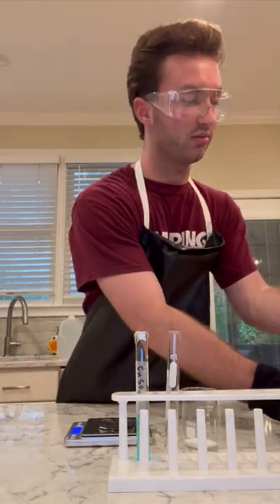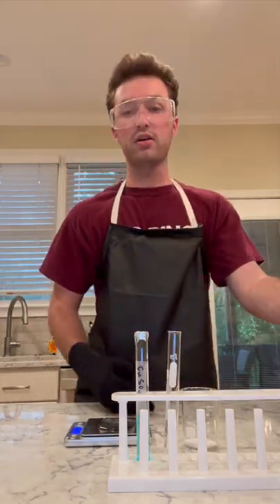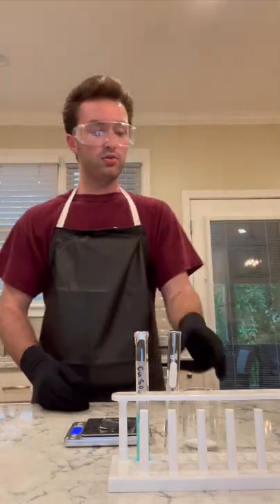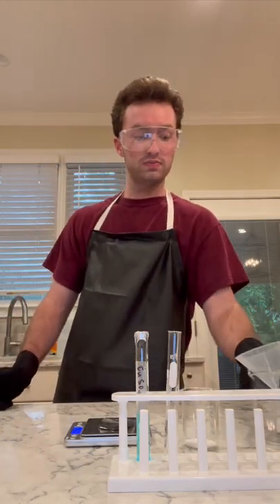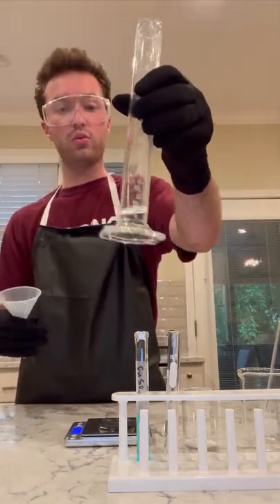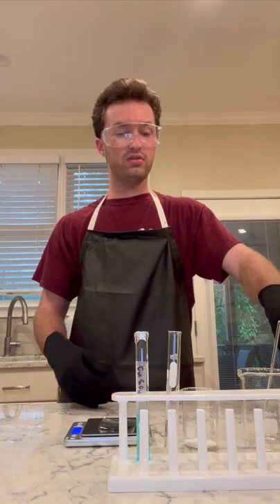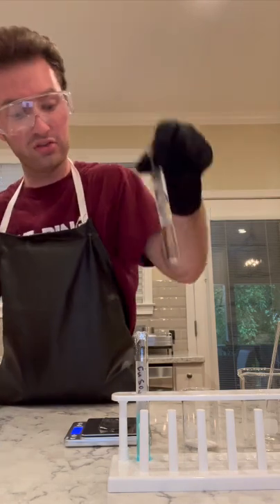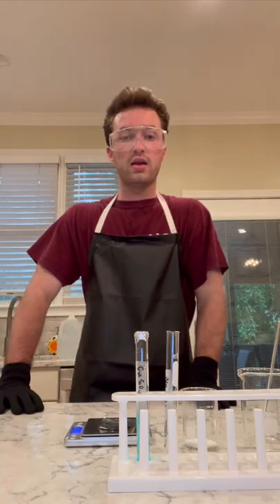I have a beaker this time, because as you can tell in the last video, we had a little trouble stirring in the small test tube. This is not the same beaker I used in the last video. That one is off to the side and cleaned out. So once I get my 1.51 grams, I'm going to be pouring it into that beaker. And then from there, I'm going to be pouring my 10 milliliters of distilled water into the beaker, and then stirring until completely dissolved, and then placing it in my labeled test tube, which is, as you can see, Na2CO3, which is the chemical formula for sodium carbonate. So now I'm going to fast forward, and I'll be back once I get prepared.